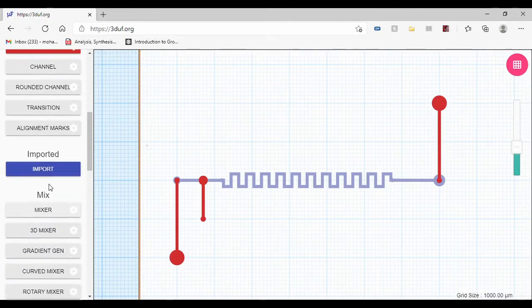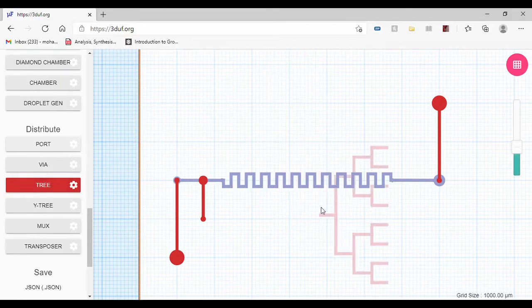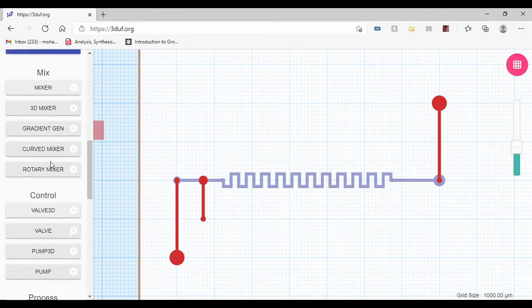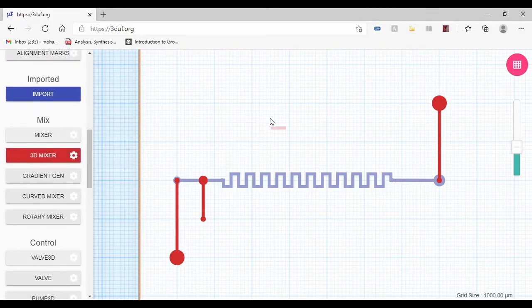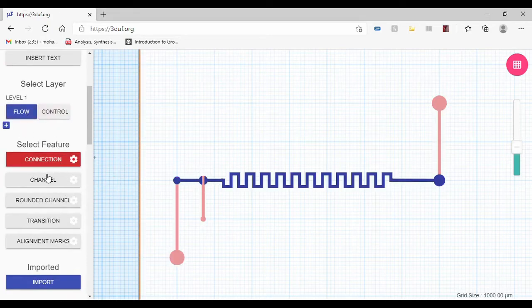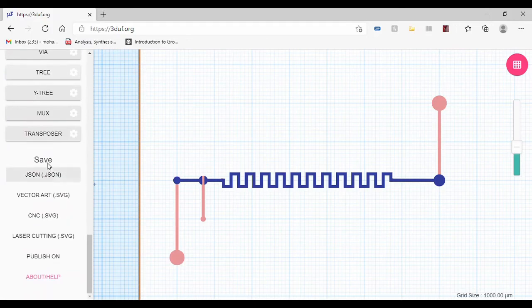Okay, there are other tools like this one or a chamber and 3D mixers. You can use all of these in this website, but again, it depends on your design and what you want to do. So this is our design. This is what we're gonna use, and this is what we're gonna export to our laser machine.